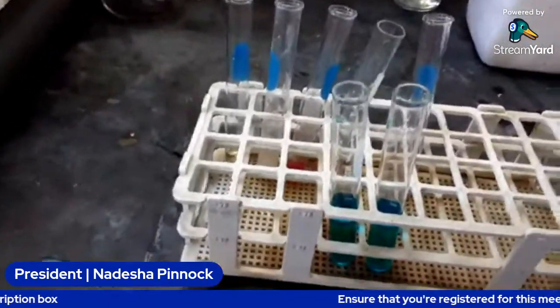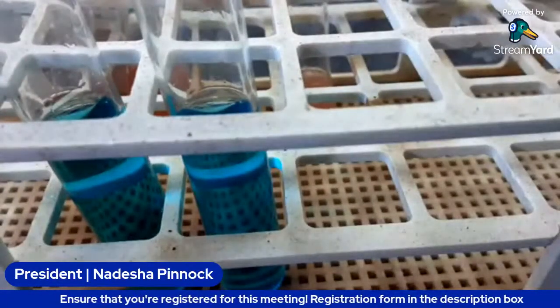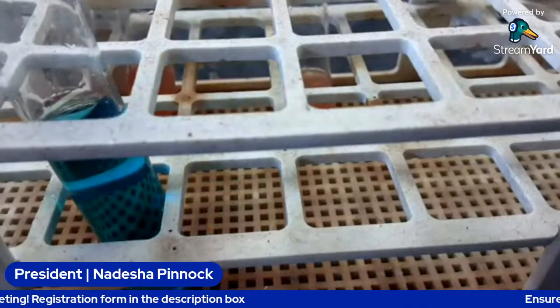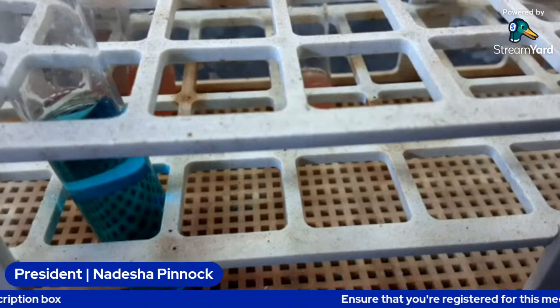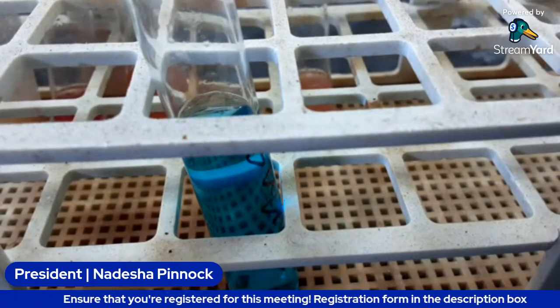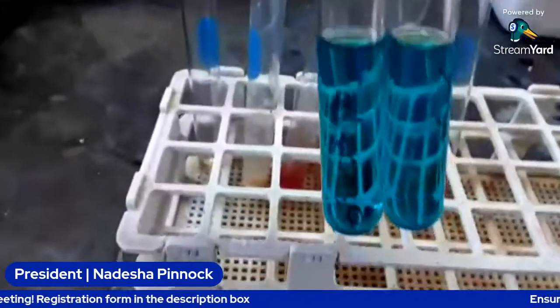Let me label them. So it's good practice in chemistry, of course, to label. So we're going to label the test tubes. This one is sucrose, and the next one is glucose. All right, so we've labeled both of them.